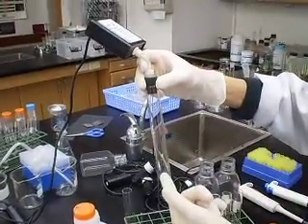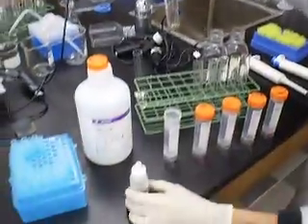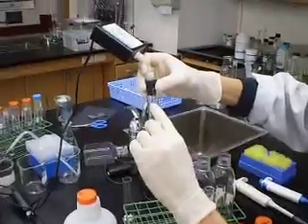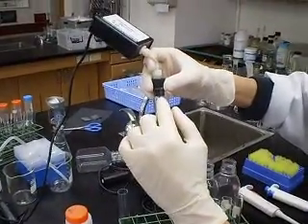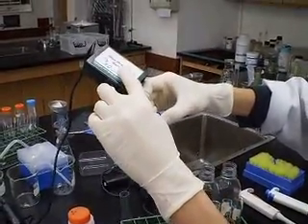Repeat again. Hydrogen peroxide, I'm going to add a bit of catalase. Oxygen gas will be produced and there will be a pressure build up. And it will be measured using gas pressure sensor.